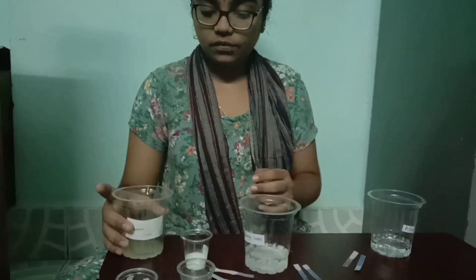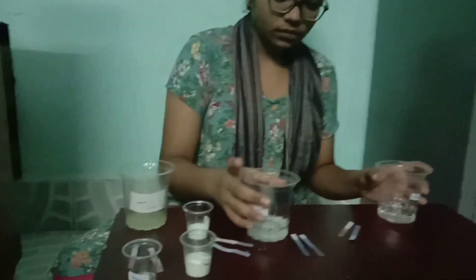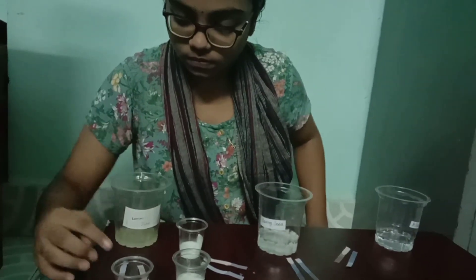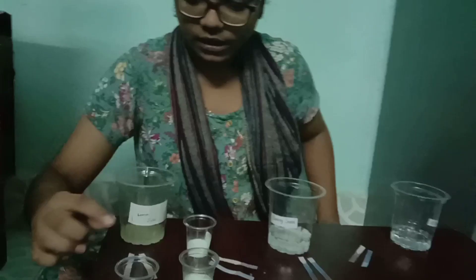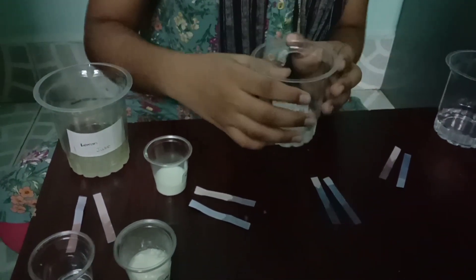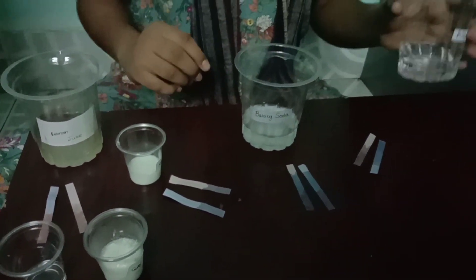At last, let us differentiate the substances into acids and bases. Lemon juice — it is acidic in nature. Sodium hydroxide — it is basic in nature. Vinegar — it is acidic in nature. Curd — it is acidic in nature. Milk — it is basic in nature. Baking soda — it is basic in nature. And water — it is neutral.